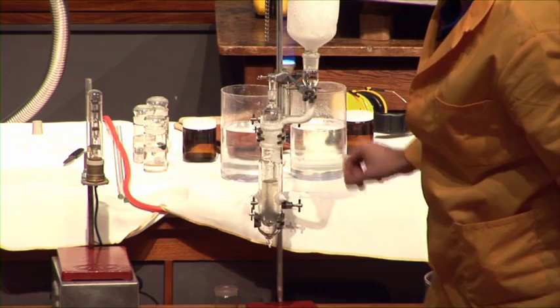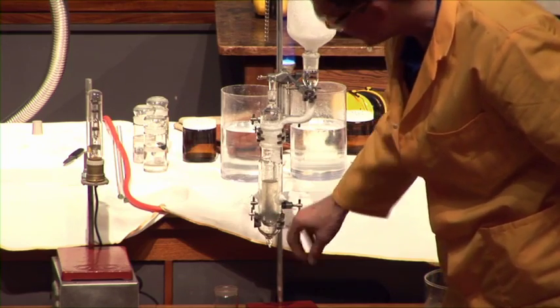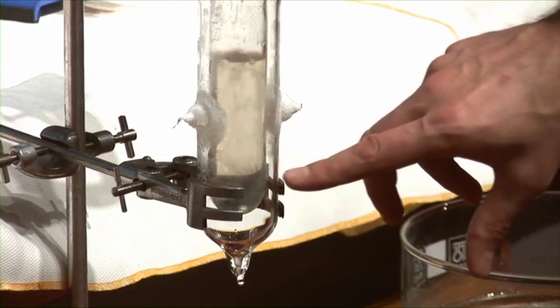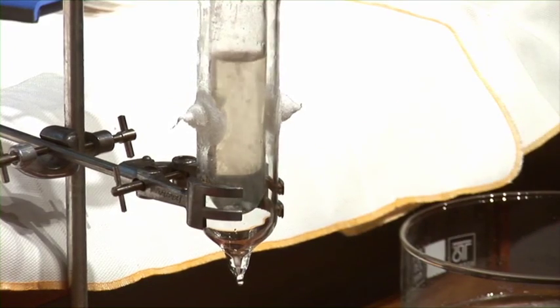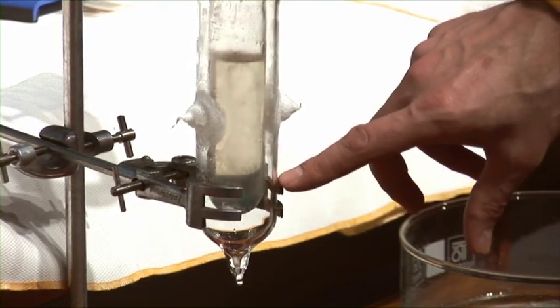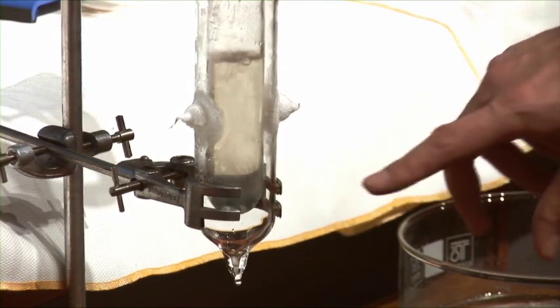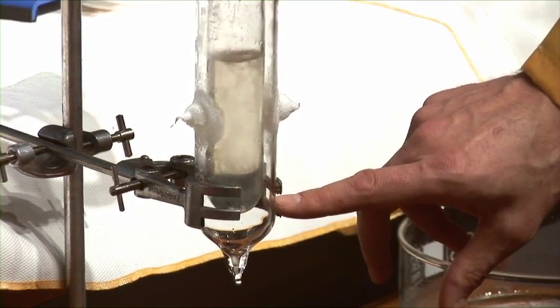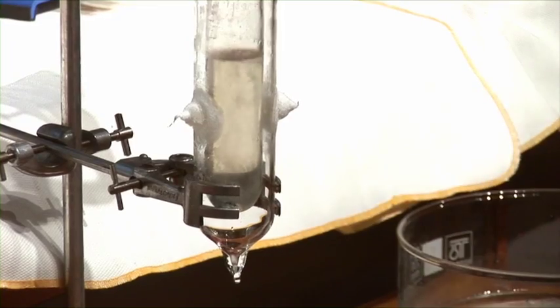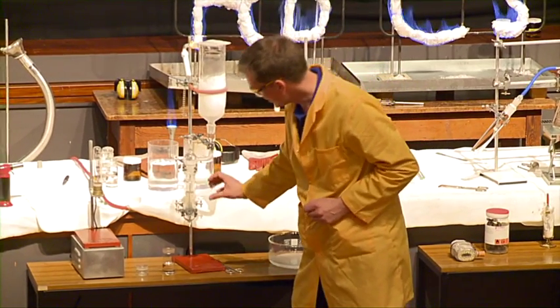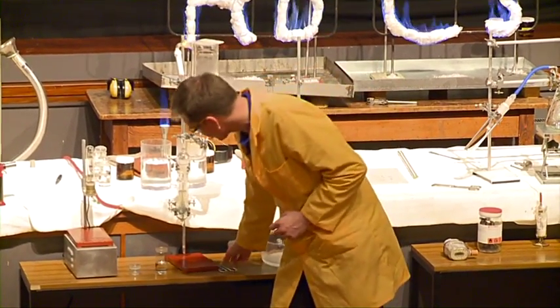And what's taking place here, the electron is coming away from the sodium metal, and it's just staying in the solution, in the ammonia. And the blue solution that's resulting, we're beginning to see a little bit forming here, is due to the free electron moving around in the ammonia. This is a solvated electron.